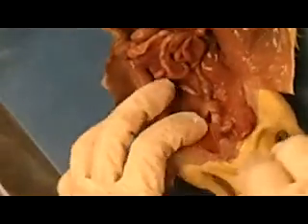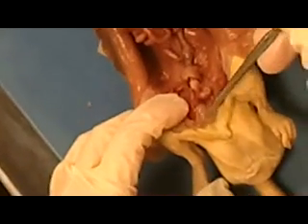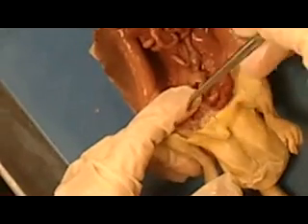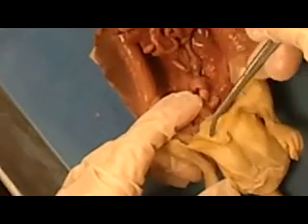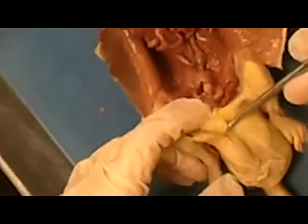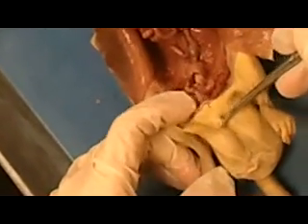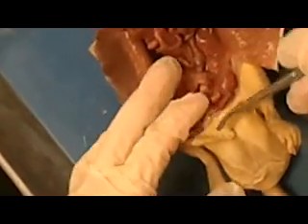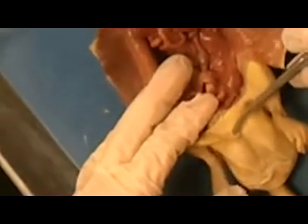Alright, the male's penis is actually right in this area right here. If you find where he urinates from and you feel right along the surface of the skin, you'll feel the bone that runs through there. And so just to make sure you know, if I tagged something or pointed out something that's down in the body cavity, it's most likely going to be seminal vesicles, the bladder, or the prostate gland, because the penis is right along the surface of the skin.